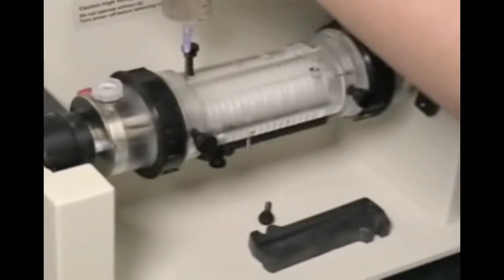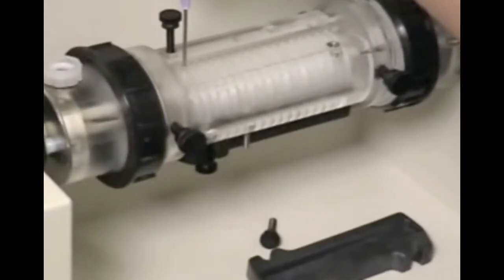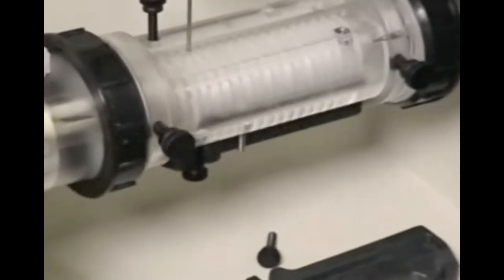Start by filling every other port. Sample will spread freely through the membrane core into the adjoining compartments.